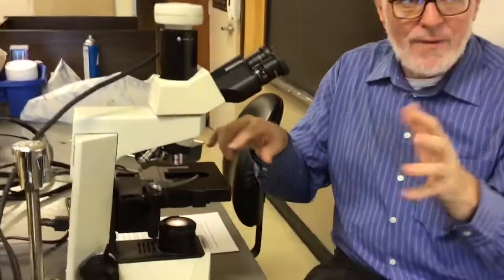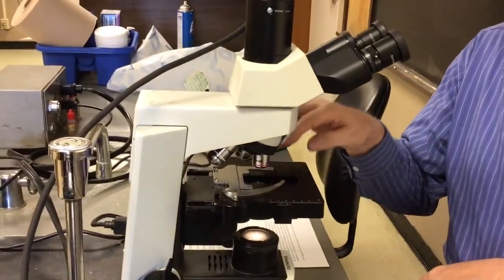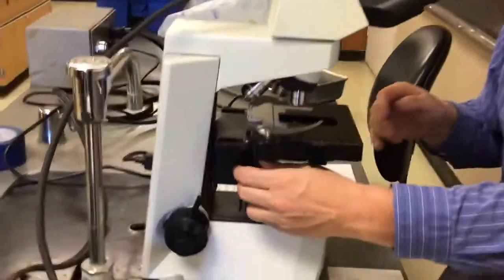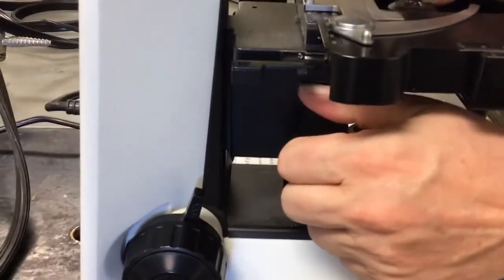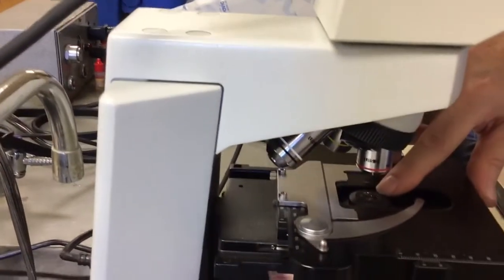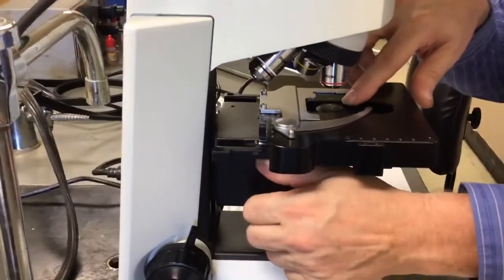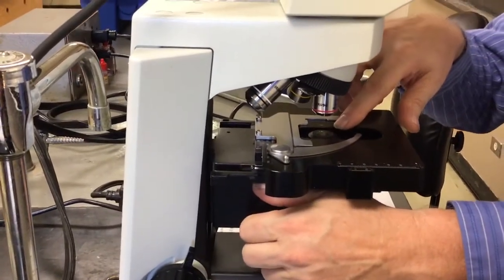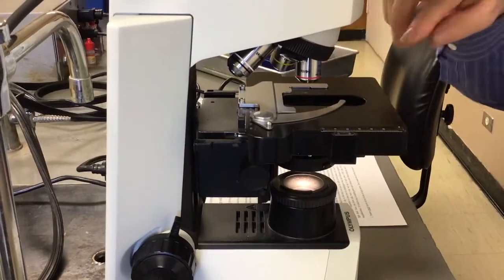So whenever you use a microscope with what's called a condenser lens, really cheap ones don't have this. There is a control here that, I don't know if you can see this in here. It moves this up and down. And it's real easy to turn this knob thinking you're turning one of the other knobs. But if you look and this thing is like buried in the hole, it's not doing you any good.